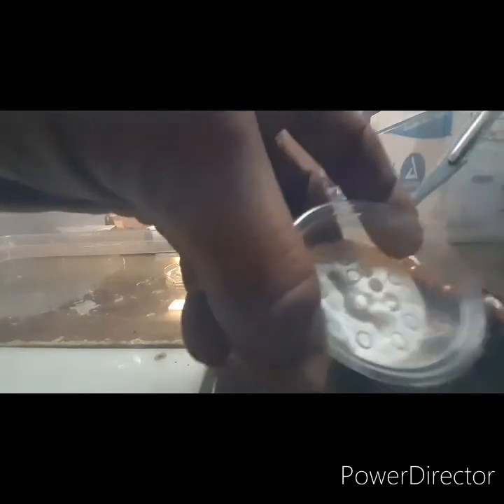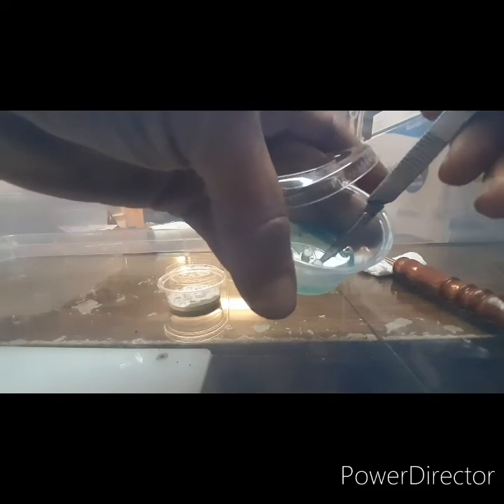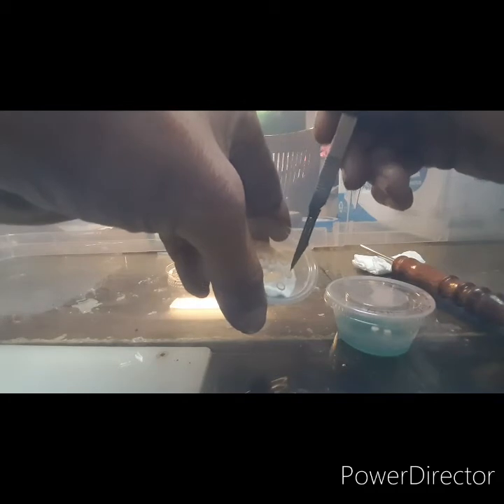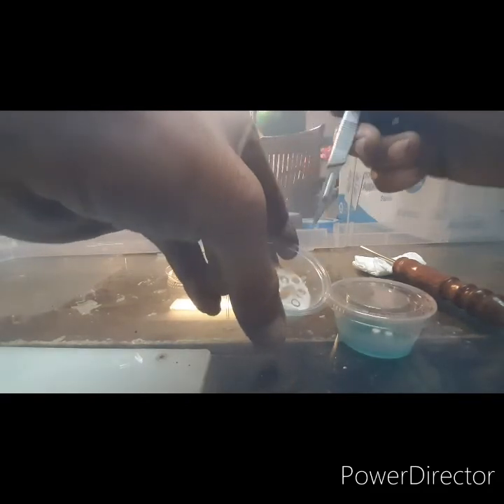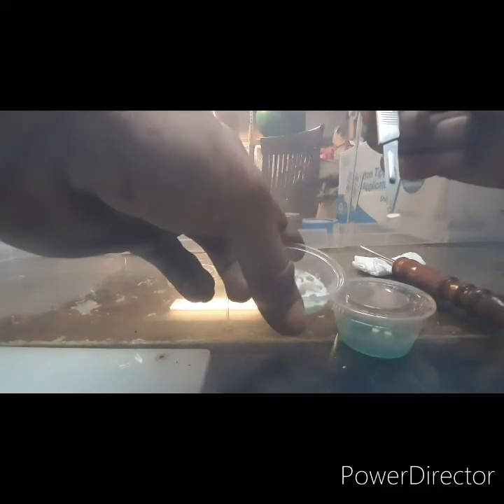Take one of these and add it to each plate. Grab it like that, bring it in a little closer — that's a bad one. Sterile technique for me — tilt it, place it, and continue on your journey. This is a super old one so it's all dry and thin — super thin. Pick them, pluck them, drop them.